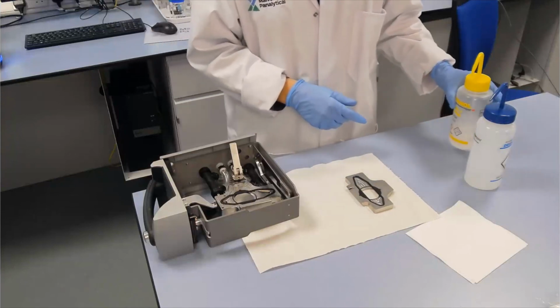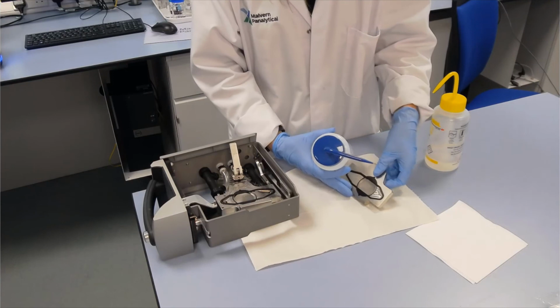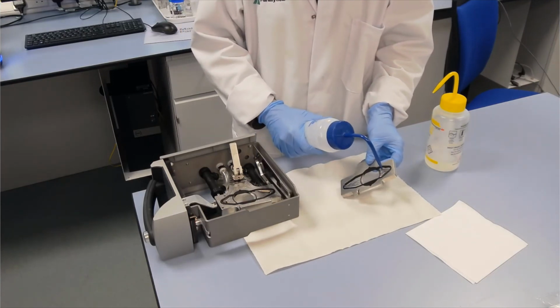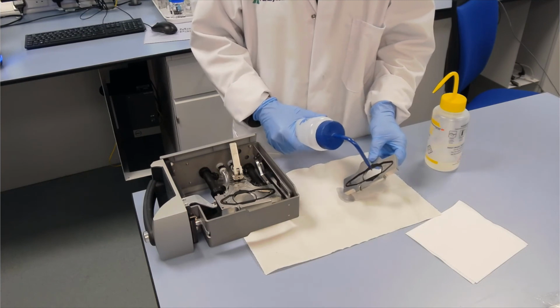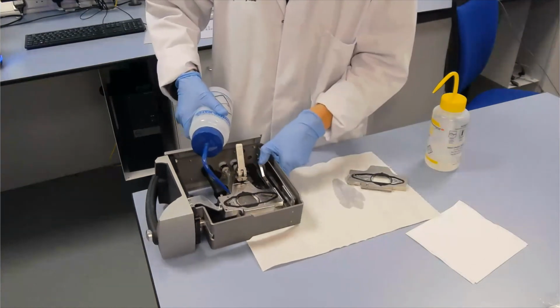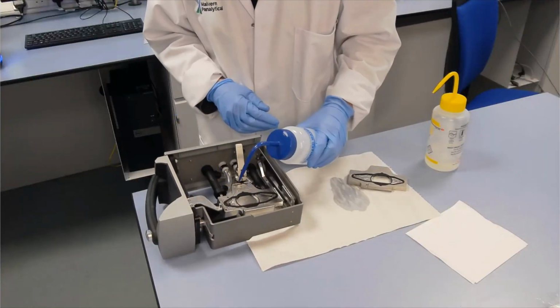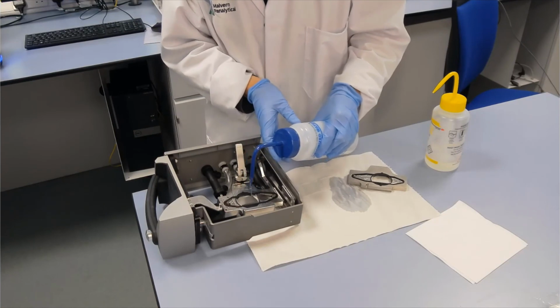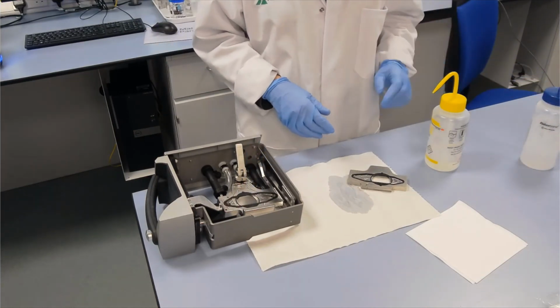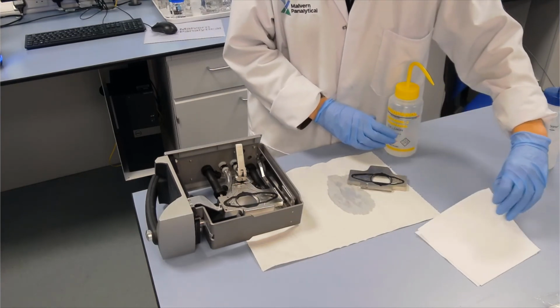So first thing I'll do is just to rinse it off with some water, just in case there's any particles left behind that might get dragged across the window and maybe scratch it. So just do that. And to the side that's inside the cell as well. There we go. So you might want to do that near a sink. It's easier to film it here.